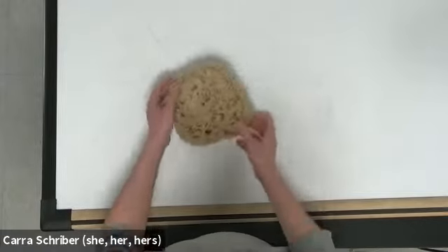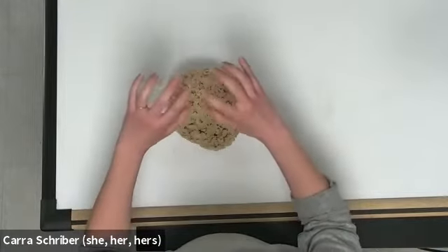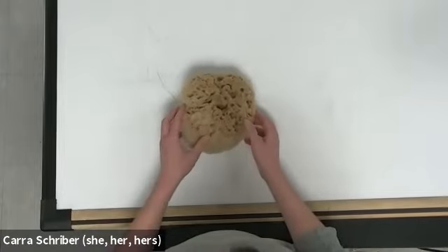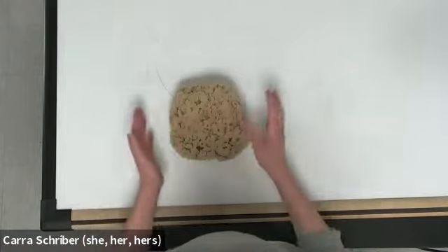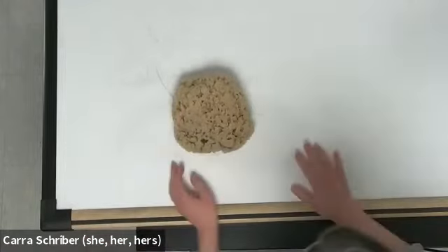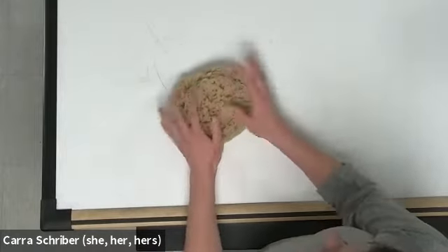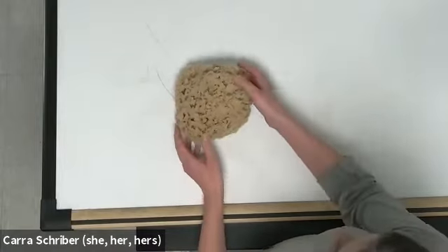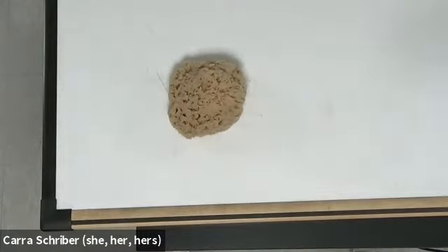And so when we're talking about sponges, we like to think about sponges having that really nice opening at the top, the osculum. But this one doesn't have a really nice, perfect, singular hole at the top. So this one's a little bit different than our model organism for a sponge, but that's okay. I wanted to give you the feel for this one in comparison to the other one. So this is Demospongiae. That's one of the classes of sponges.